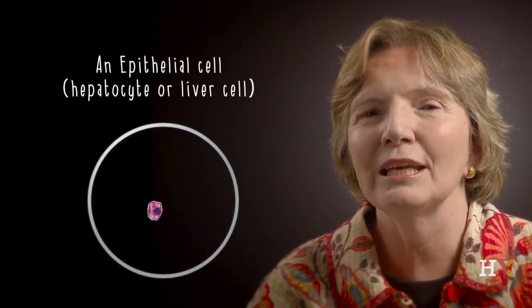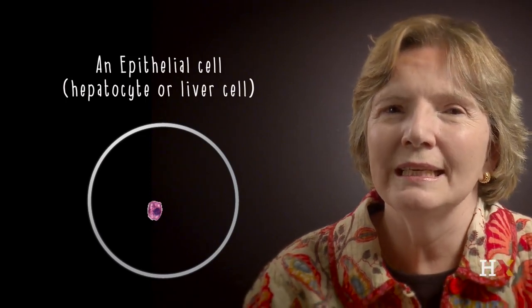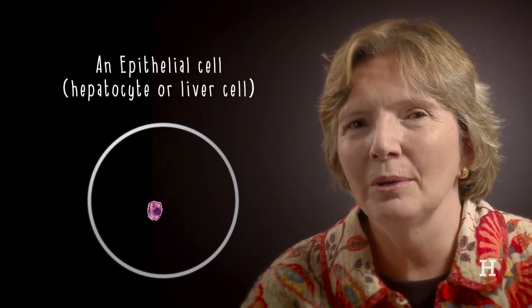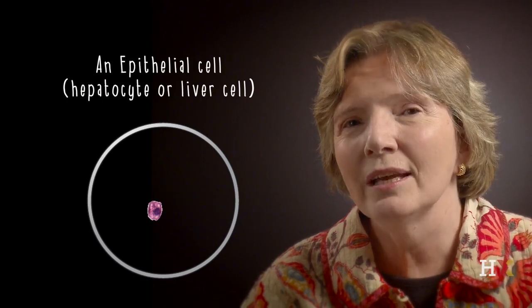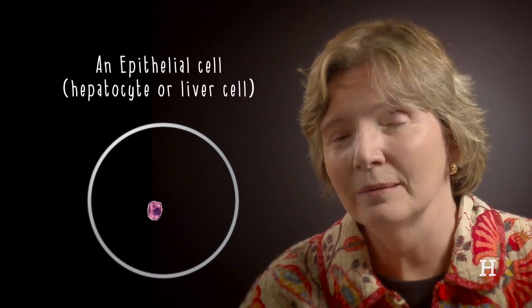So this is a cell, and if we basically erase the rest of the cells, we're looking at an individual liver cell. This is a good example of a liver cell. You can see a very busy cytoplasm because of all the important metabolic functions of liver. And you can also see very light areas, which are deposits of fat within the liver cell.